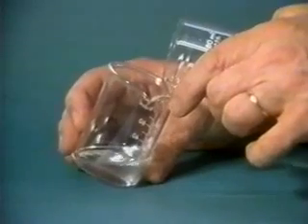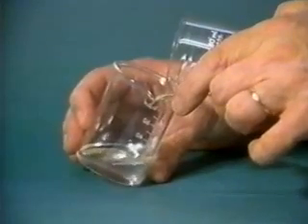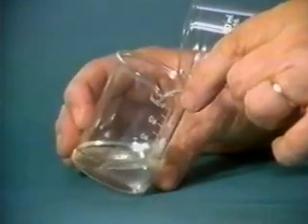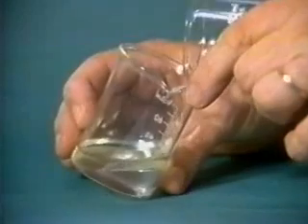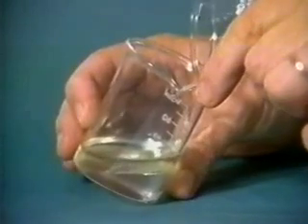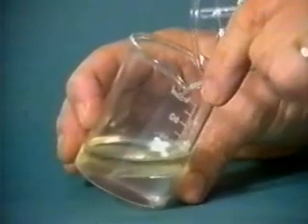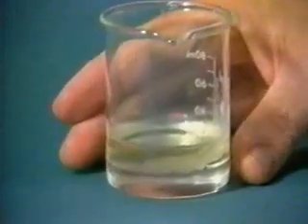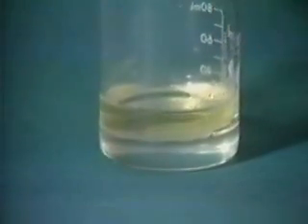The amine is dissolved in aqueous sodium hydroxide and poured gently into a solution of decanedioyl chloride. A white film of nylon 610 forms between the layers.